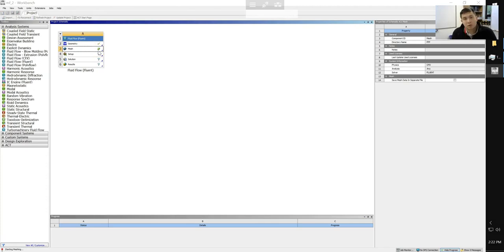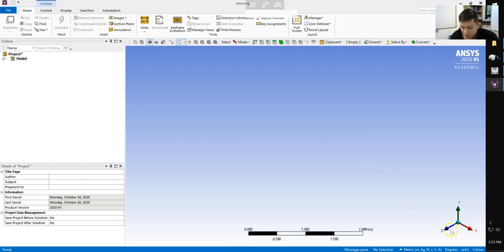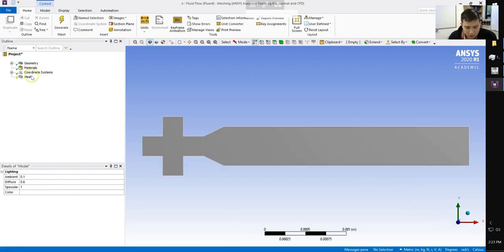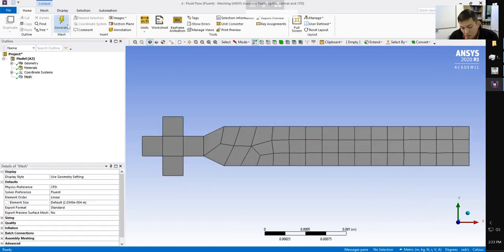In our mesh, we're going to do a couple of things. We're going to define some of the basic properties of the mesh. We're going to include an inflation, which allows us to have a nice high-resolution boundary layer along some of our walls. And then we're going to, of course, name our boundaries so we can use them in our solver setup. Okay, it's loading up our geometry now. And just out of curiosity, we can take a look at our base mesh, which is obviously a pretty low resolution.